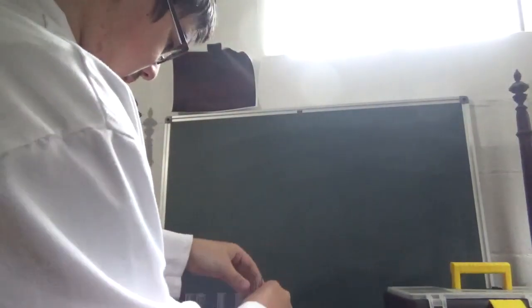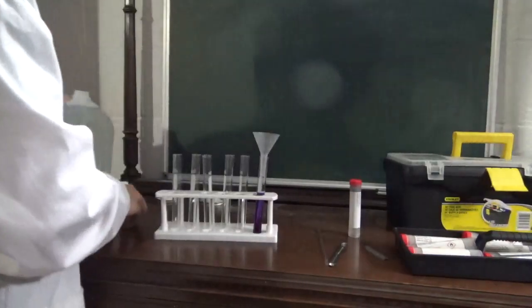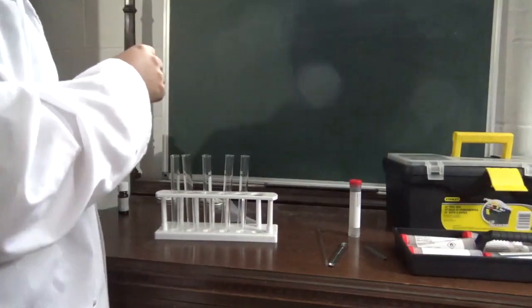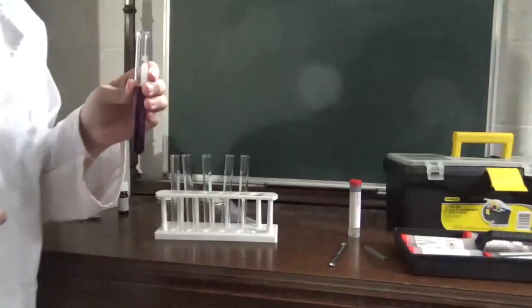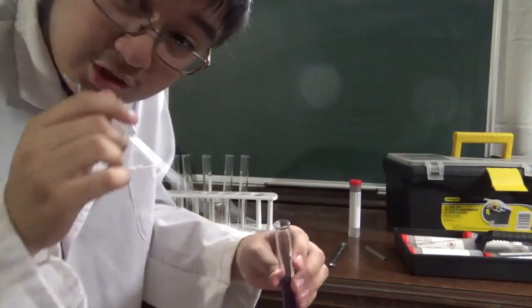I might need to add more water because I do feel some solids still left in there. So we're going to add more water, just a little bit. Okay, that could have been bad. You don't want to overshoot it. And yeah, that actually looks pretty good.